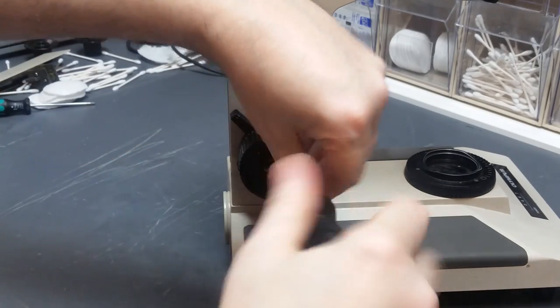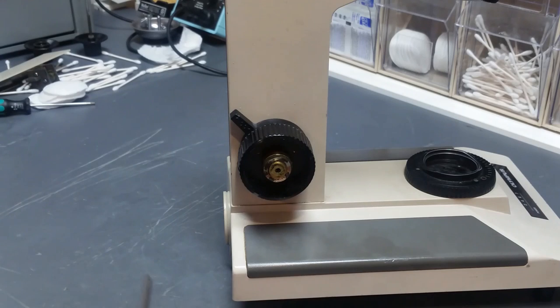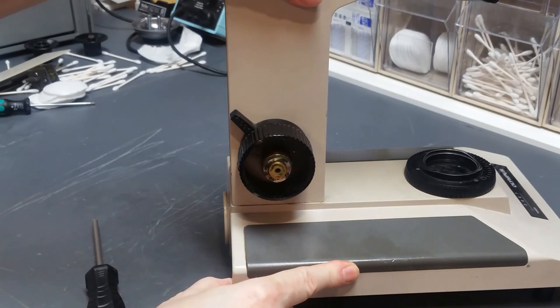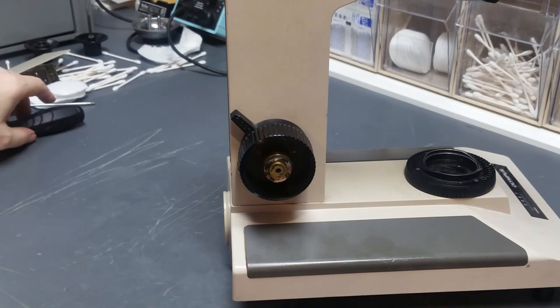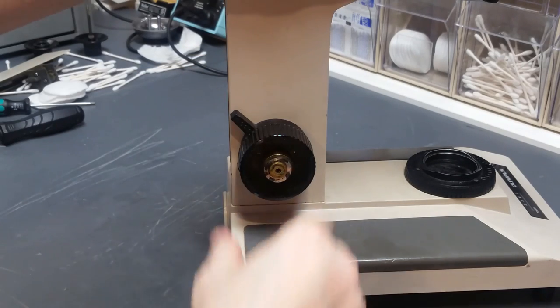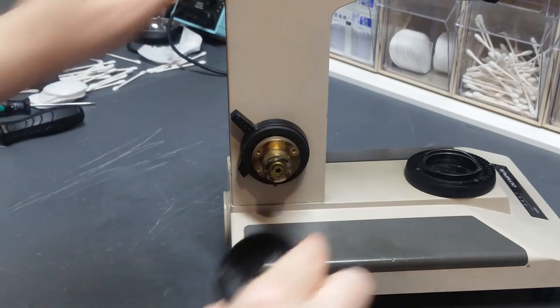And number three. You may have noticed that the arms slipped a little bit on the base here because I've just got it loosely installed just for the purposes of this portion of the rebuild. Okay, so the screws are out. Now we pull the knob. We'll have to clean that up before it goes back on.